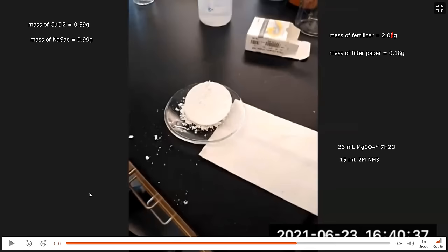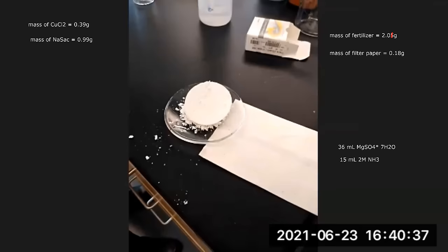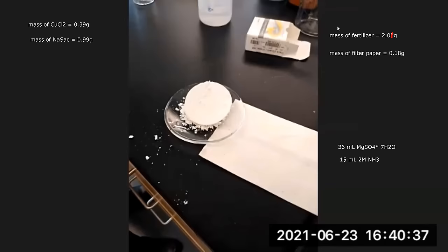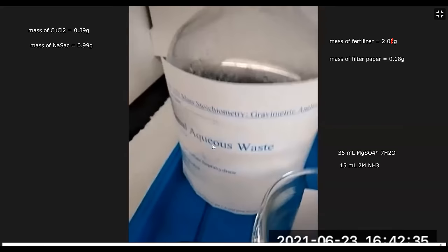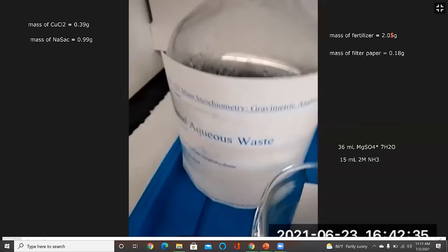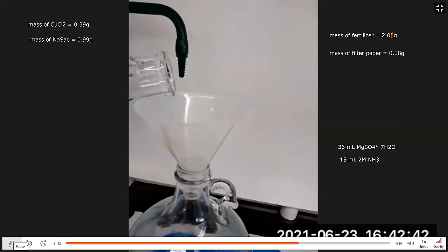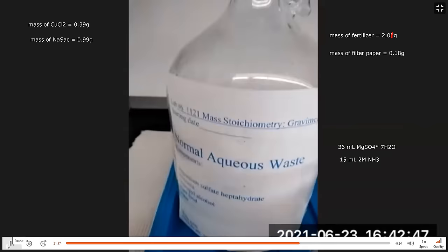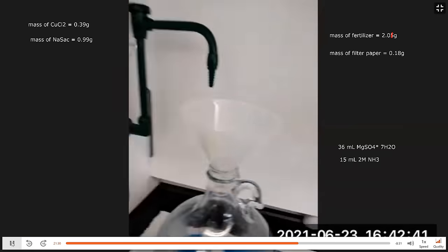Now place the fertilizer product in the oven and go filter the copper saccharinate product from the first part of the lab. For waste disposal: the filtrate collected from the fertilizer part goes into a specific aqueous waste container labeled with the reagents used — magnesium sulfate heptahydrate, ammonia, isopropyl alcohol, and plant food. Each part of the lab has its own waste containers.